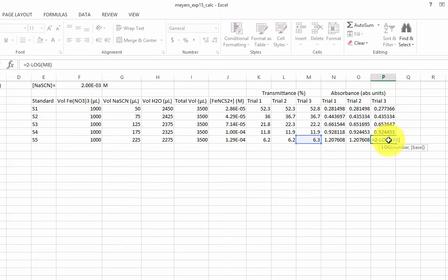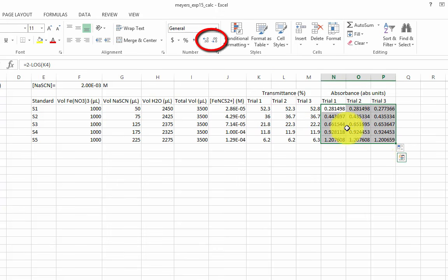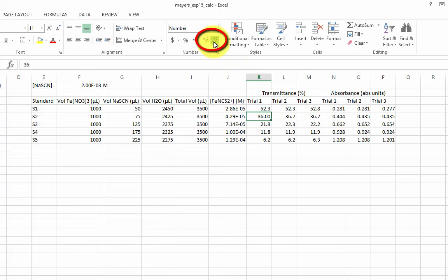We obviously shouldn't have 6 significant figures here. In order to change the number of decimal places shown, use these buttons in the Home tab of the ribbon. If you need to, go back and review sig figs for log functions.